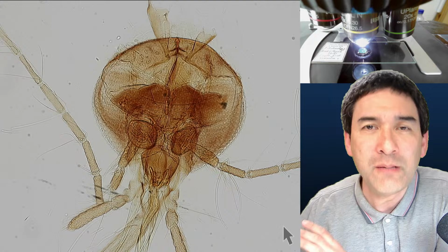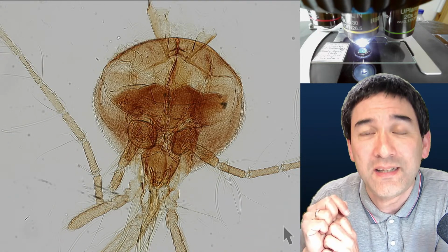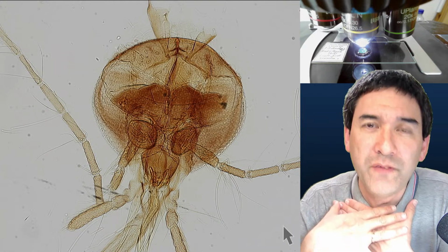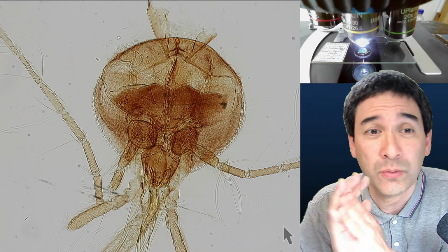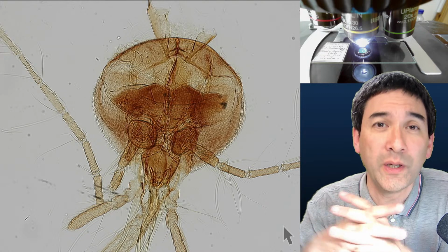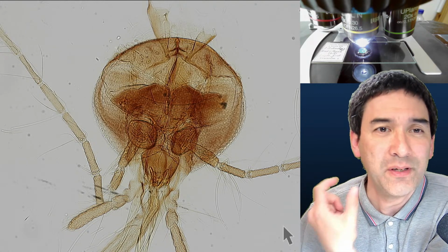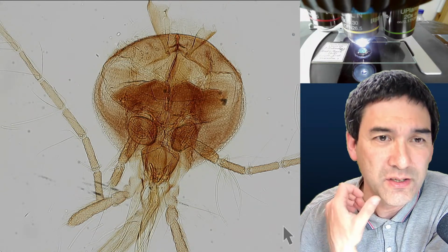So large images have a real advantage also because they allow you to do a little bit more video editing as well. Generally, when I do video editing, maybe that's also something that I would like to share with you. I want to include movement, but this slide that you see over here is a static slide. Obviously there's no movement here.